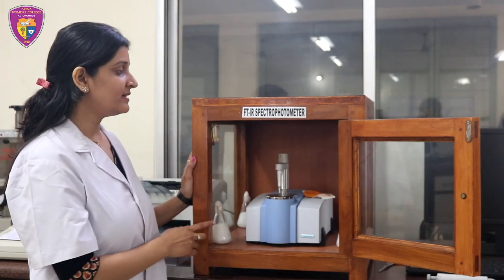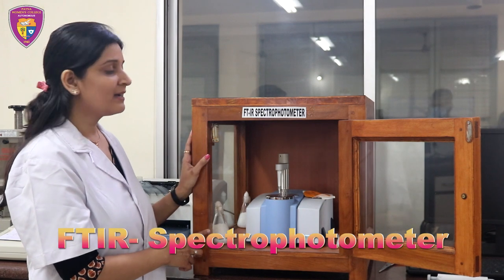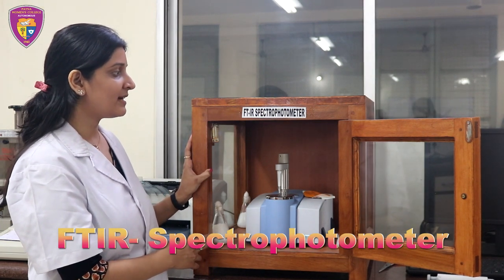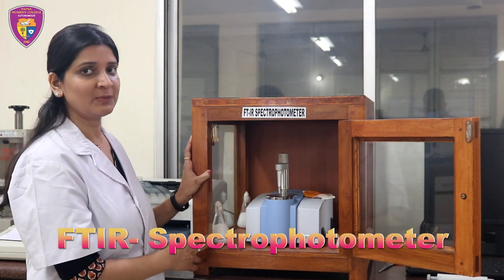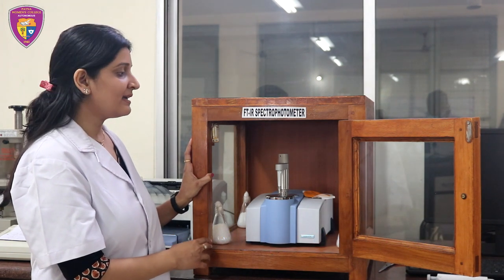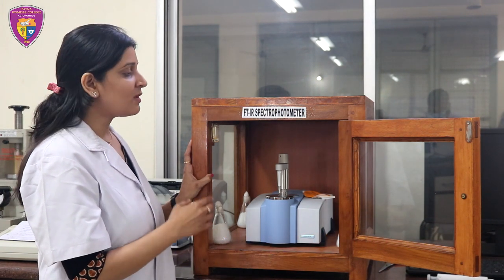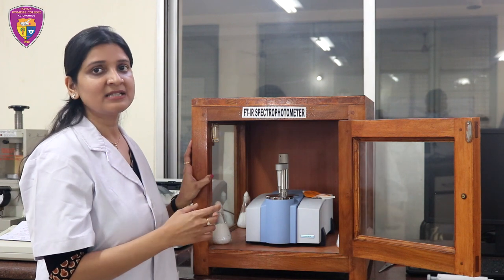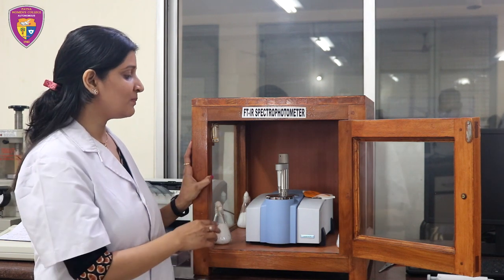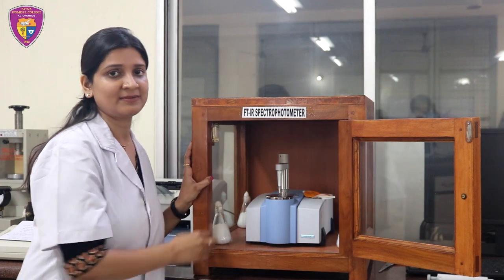This equipment is an FTIR spectrophotometer. FTIR stands for Fourier Transform Infrared Spectrophotometer. In FTIR spectroscopy, infrared light is passed through a sample. Some of the IR is absorbed by the sample and some passes through. This equipment is used for the identification of unknown materials.